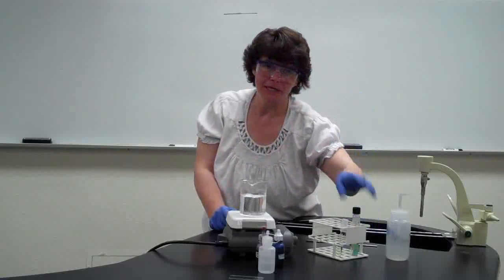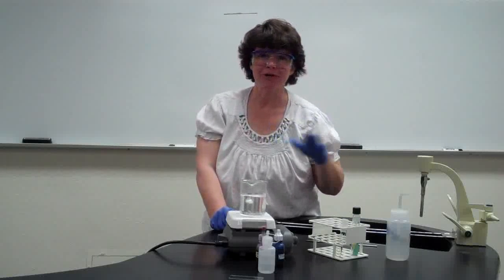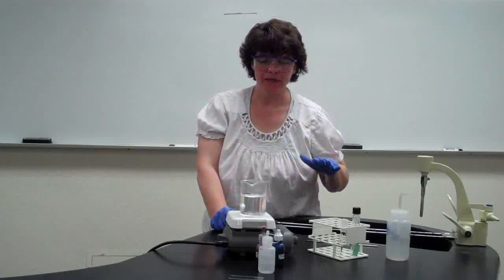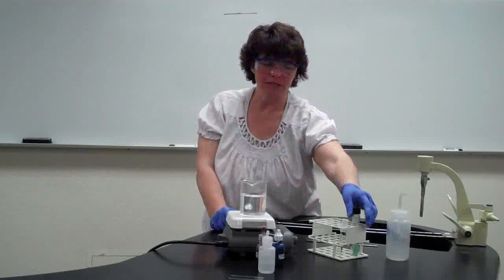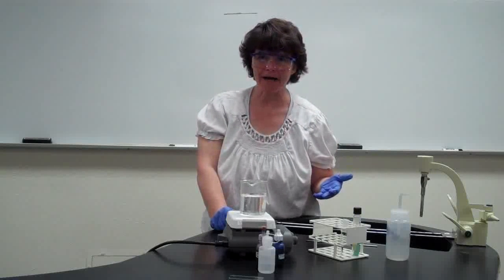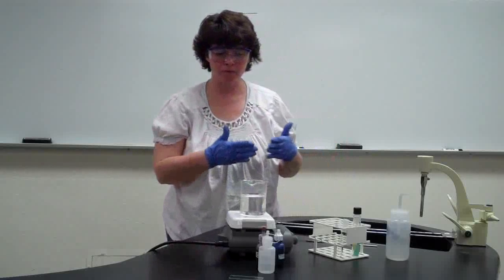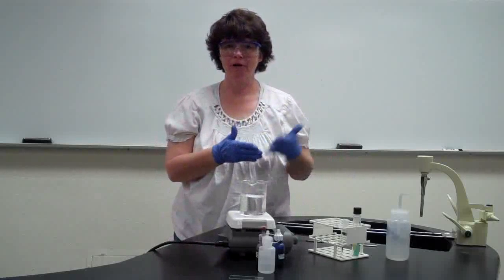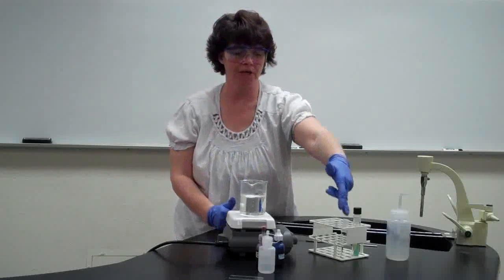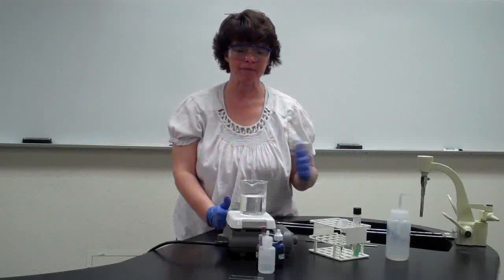these. Because it's taking from a solid, you'll have to do that technique of putting the water in first, adding the bacteria, and then spread it around so that you get a single layer of bacteria. Once again, because it's kind of chunky, that's going to be a little bit more difficult than what we've seen in the past. Now, what doesn't change is that you prepare and fix your slide. So whether it's from here or from here, you do the same procedure for the fixing.